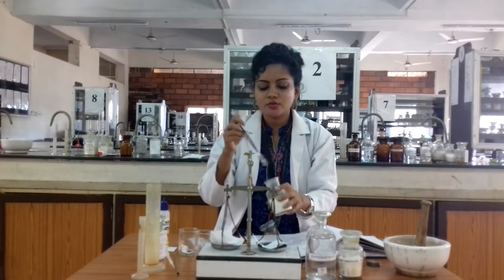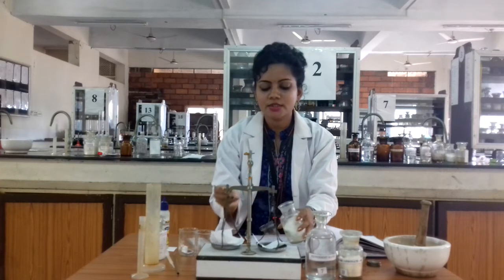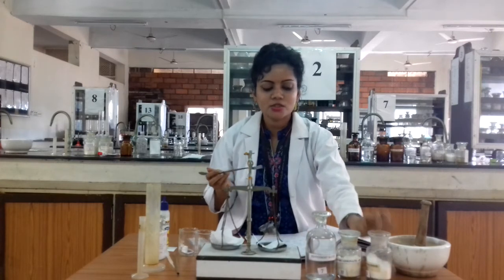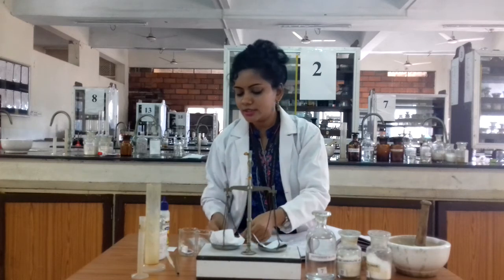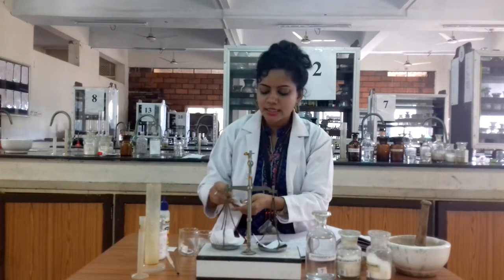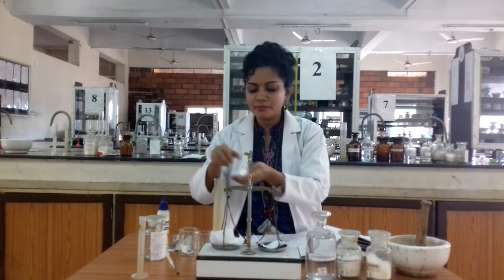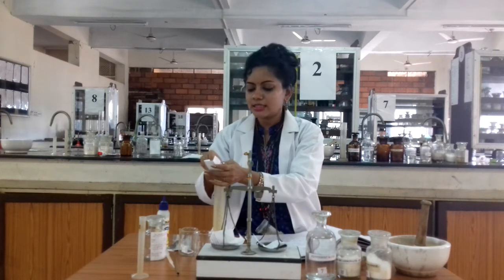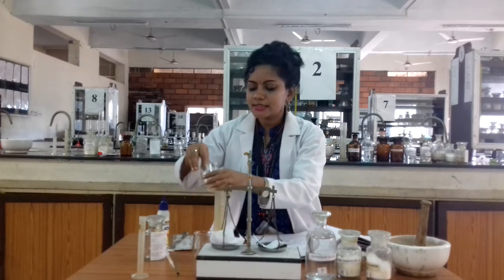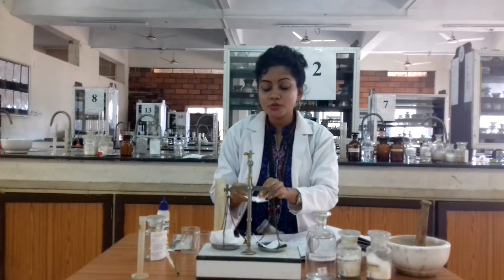Using a spatula, I am first going to weigh the sodium chloride — it acts as a good antimicrobial and antiseptic. I have already weighed both ingredients: sodium chloride and sodium bicarbonate. We transfer them to the measuring cylinder; no need for a mortar and pestle. We add the sodium bicarbonate, which helps to neutralize the preparation.